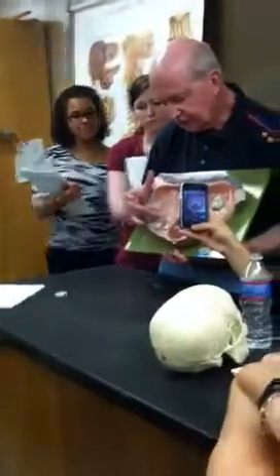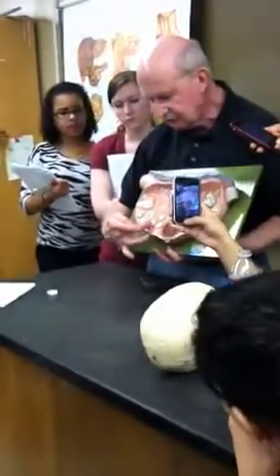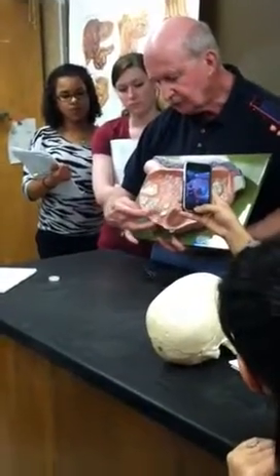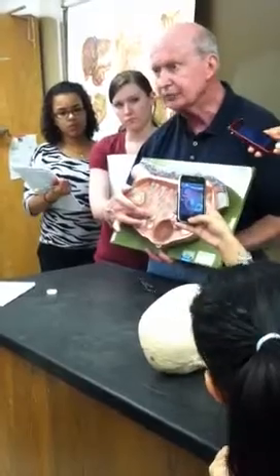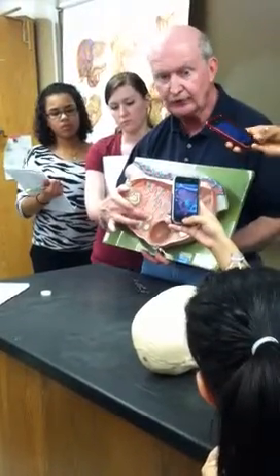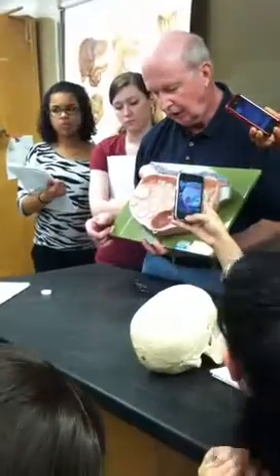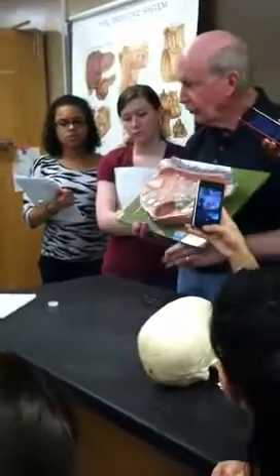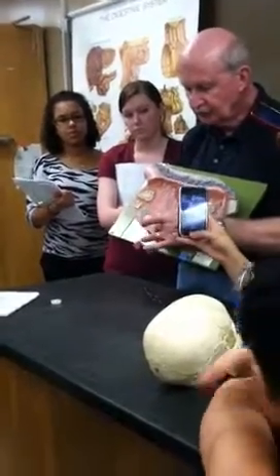You probably can't see this from where you are, but if you look at these growing stages, those two still have very discernible nuclei. That one, the nucleus has exploded. This is an atretic follicle. It's getting ready to just go by the wayside. Okay, so anyway, here we are, day 14, day 15. We have our tertiary follicle.